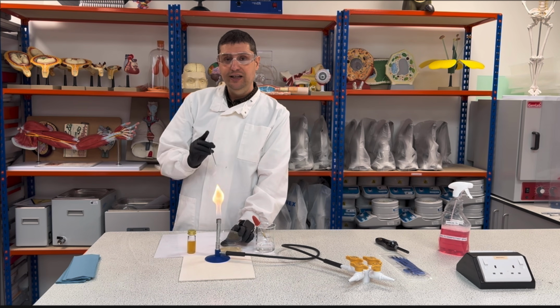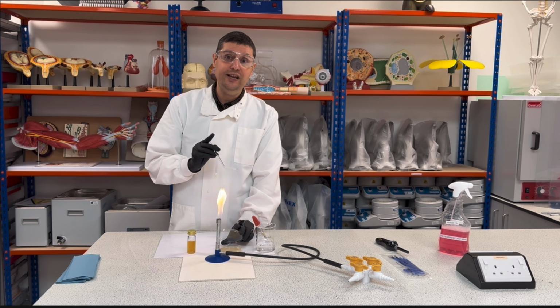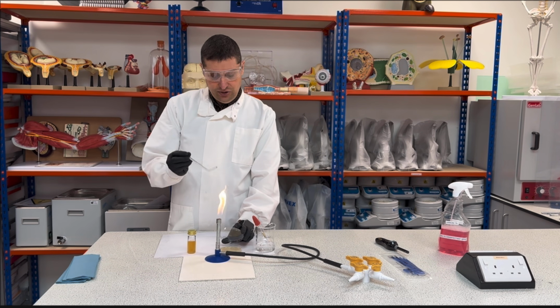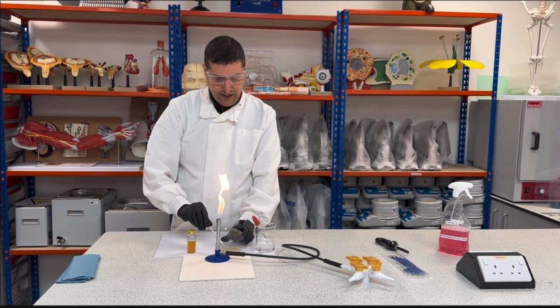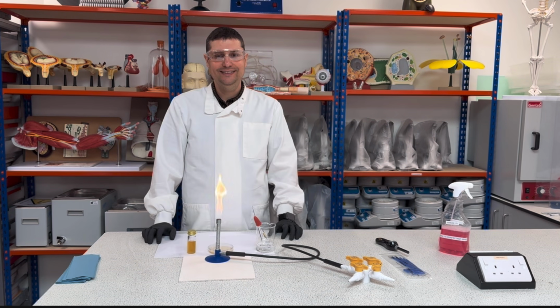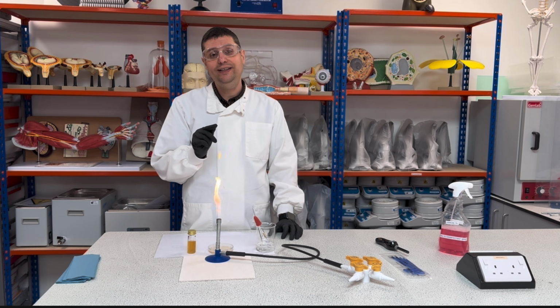Why facing you? Because you might cough, you might sneeze, someone can talk, and pathogenic bacteria can go there and will grow pathogenic bacteria rather than the bacteria I want. So this is like a shield. So the correct way is I'm gonna use here and spread everywhere. Okay? Then I close and put it. Just to highlight one thing, it's very important for you to wait the equipment to cool down. Otherwise, you are gonna kill the bacteria.